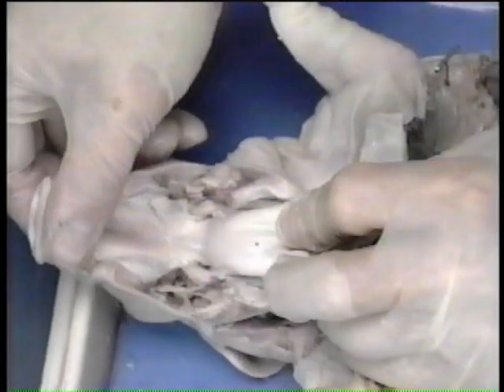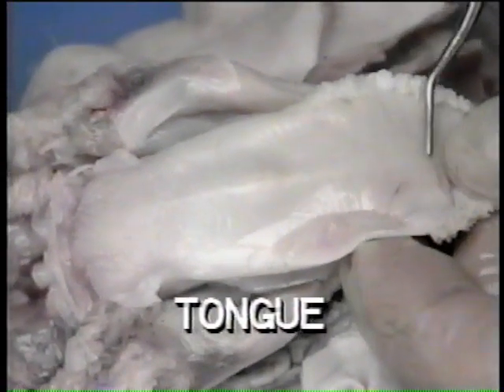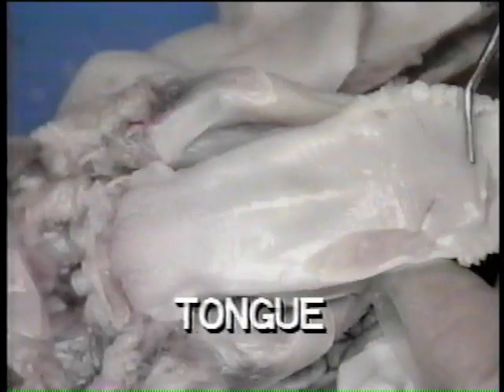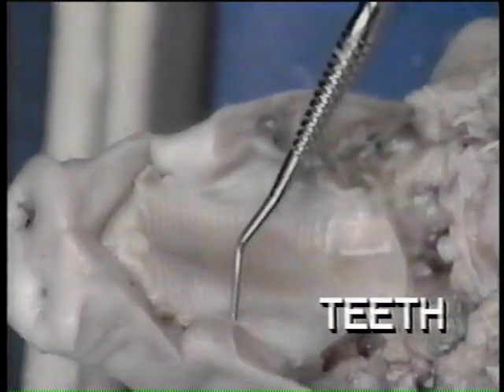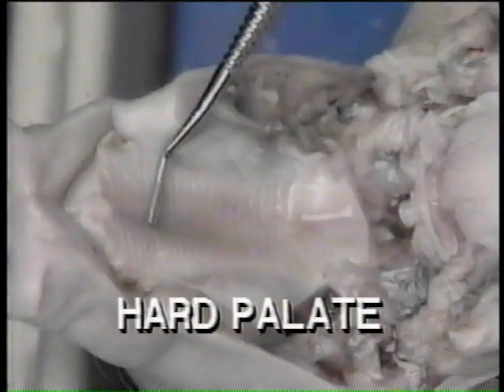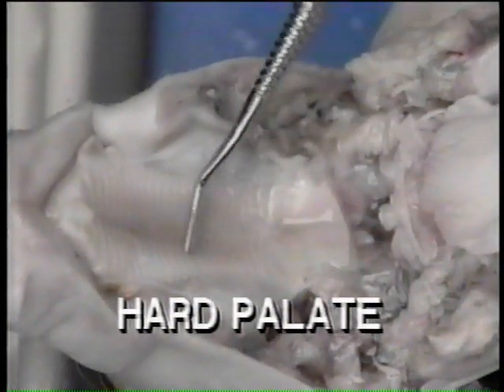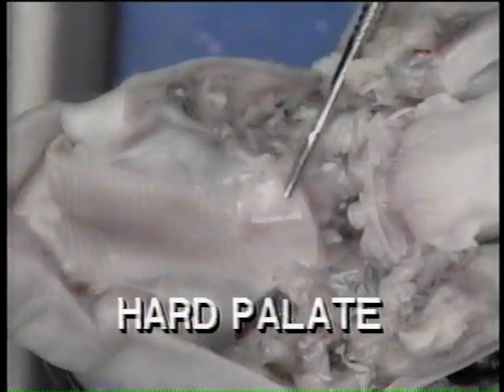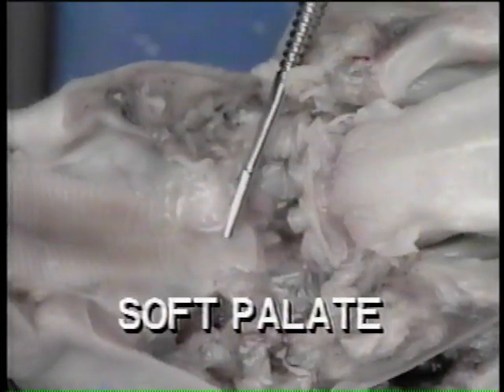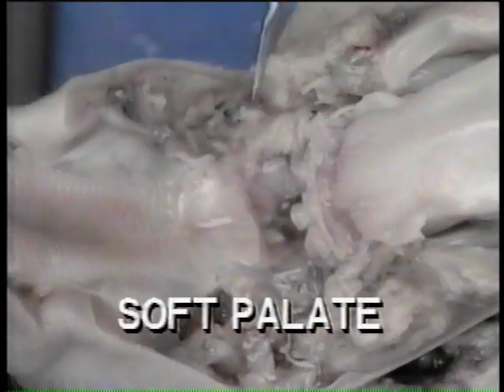Examine the oral cavity. First, look closely at the surface of the tongue and observe the numerous papillae that contain the taste buds. Teeth may be evident in the fetal pig, depending upon its age. The hard palate is composed of bone and is covered with a mucous membrane. The soft palate is the caudal continuation of the mucous membrane that covers the hard palate.